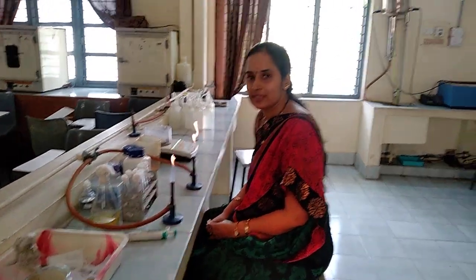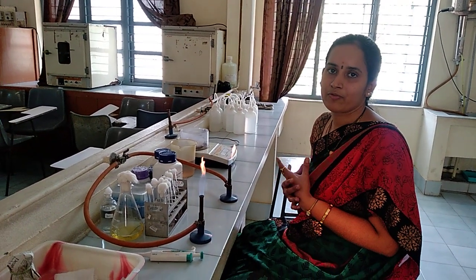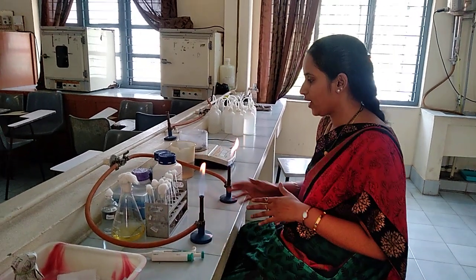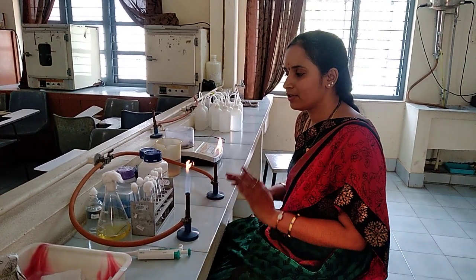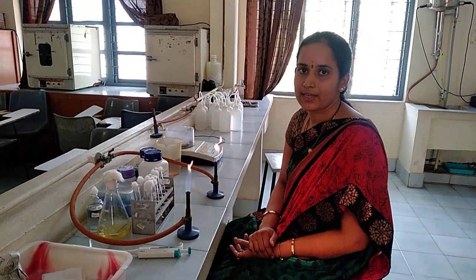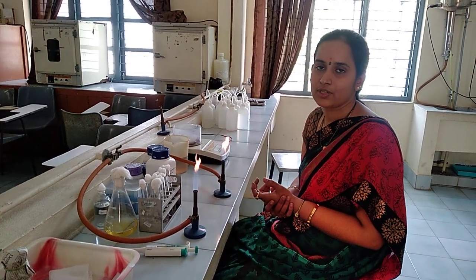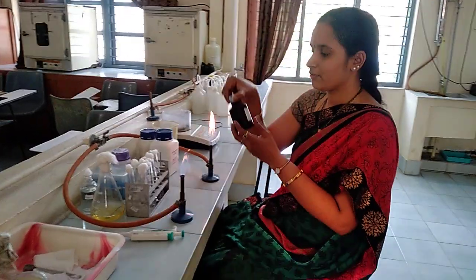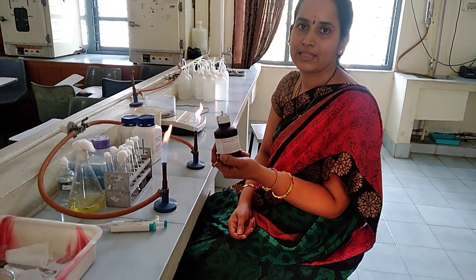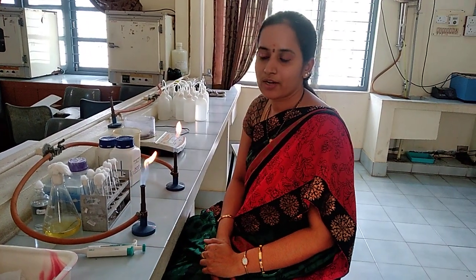Hello students, today we will see another experiment which is isolation as well as identification of fungi. We require PDA agar medium — potato dextrose agar medium. I will show how to prepare the PDA medium and then how to identify the fungi by staining with lacto-phenol cotton blue, which is the stain used to stain fungal cultures.